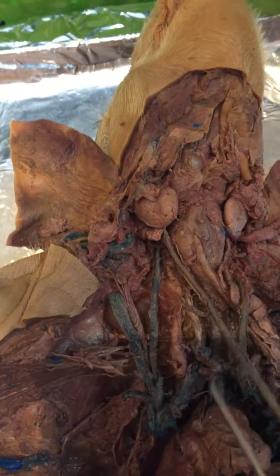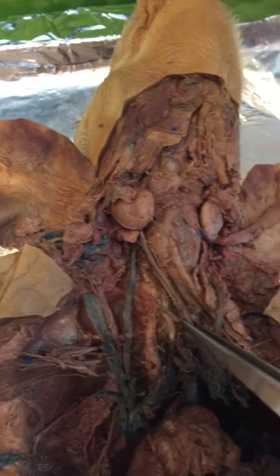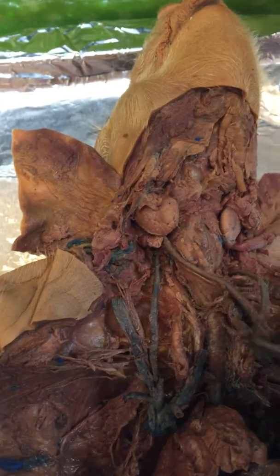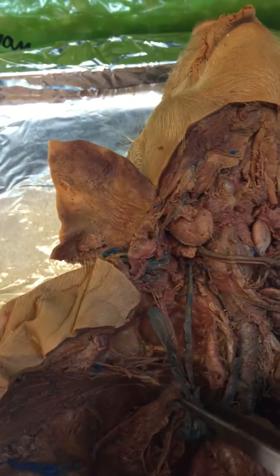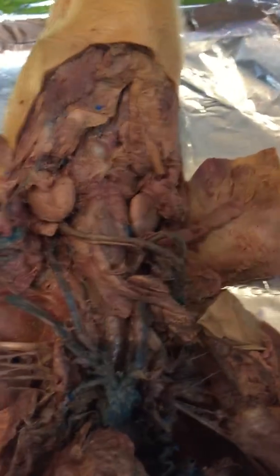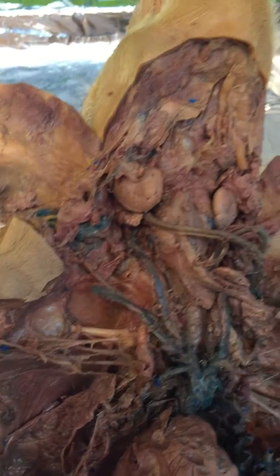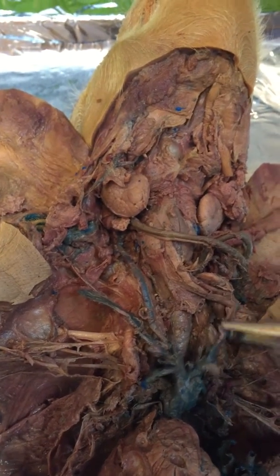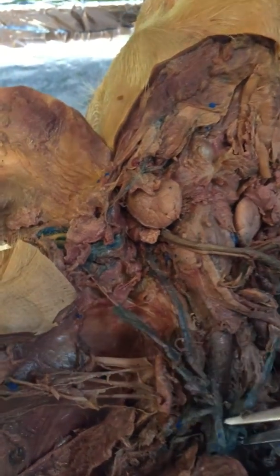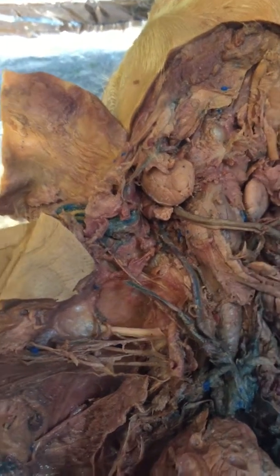Bringing this back into place, this is the left carotid artery. This is the right carotid artery. Now pulling all of this out of the way, I'm going to bring the veins back in where they would have been originally. So first off, this is the internal jugular. This is the external jugular. I accidentally severed it on this side, but this would have been the external jugular. And you can see a little bit left of what would have been the internal on that side.